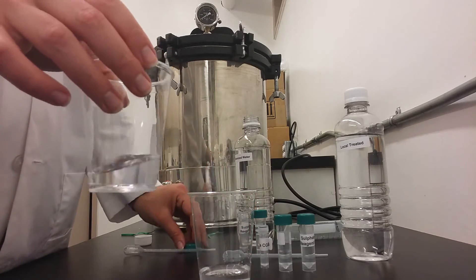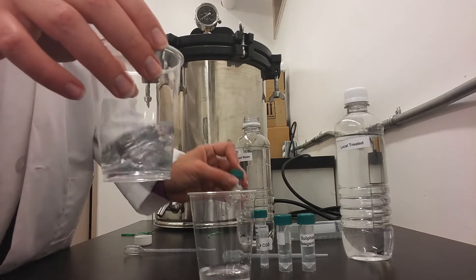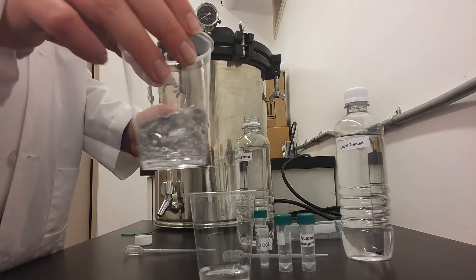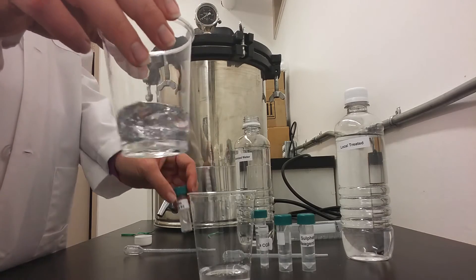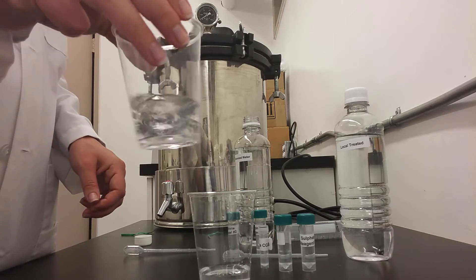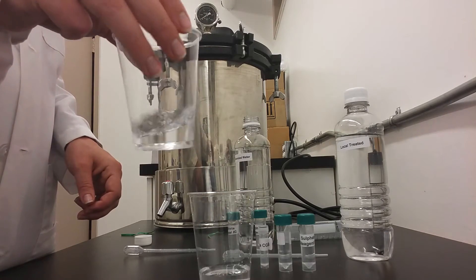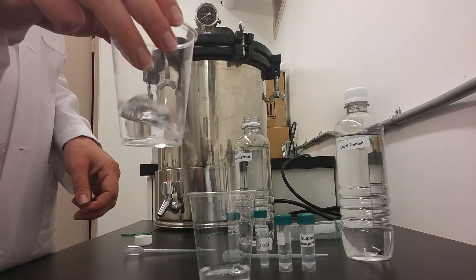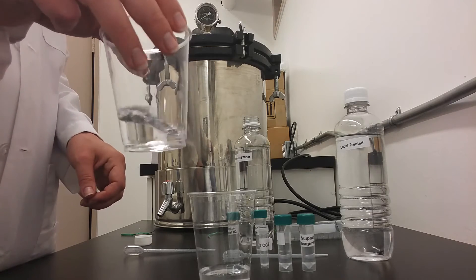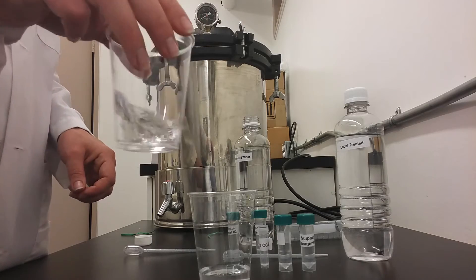You will continue to swirl that control cup for approximately 1 minute. Once it has been swirled for approximately 1 minute, you will set it aside.